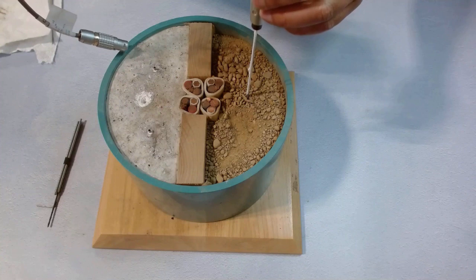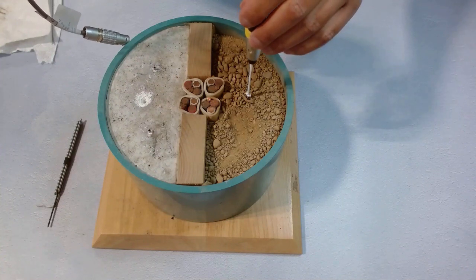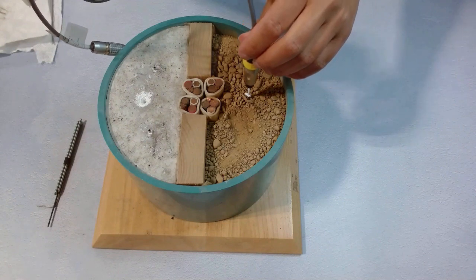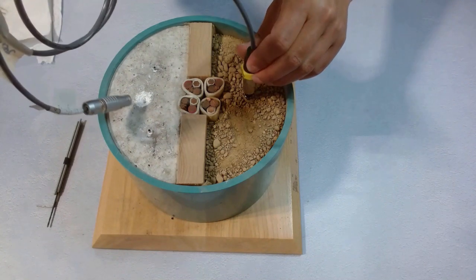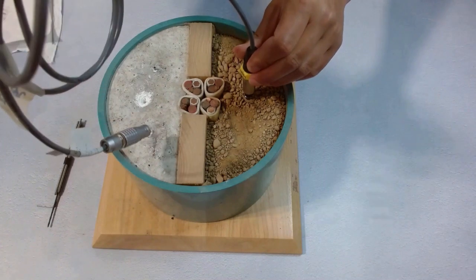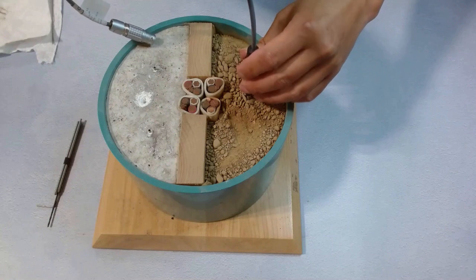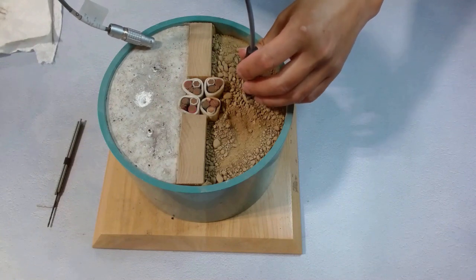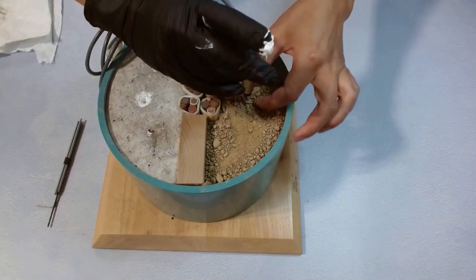Now we try to insert the TLS100 into the needle sleeve. Make sure it's straight, and also gently and slowly so the excessive thermal paste gets pushed out. We gently twist it a little bit about 90 degrees to spread the thermal paste evenly.